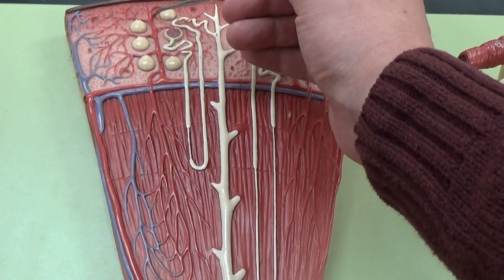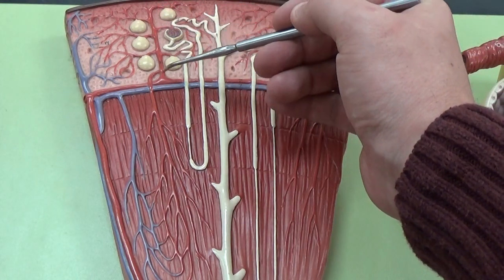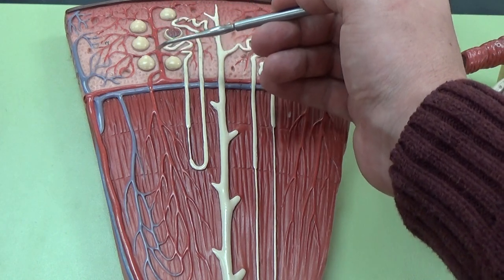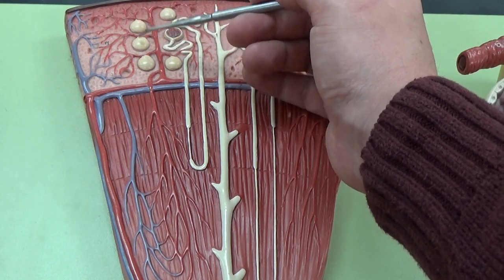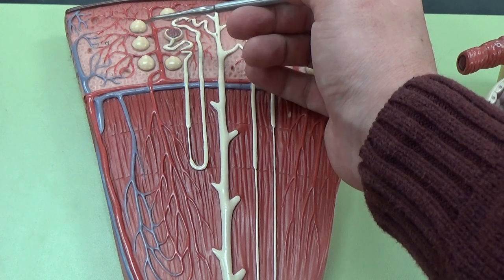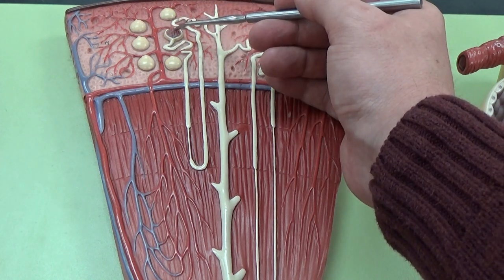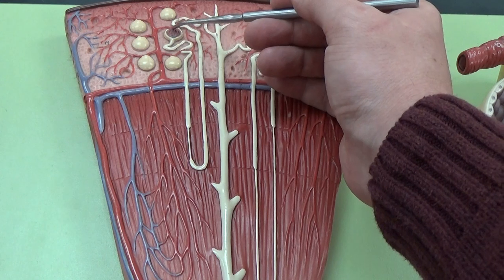Here is the cortical radiate artery we talked about in another video. The individual white sacs that you're seeing here are the renal corpuscles. Inside the renal corpuscle is the glomerulus.